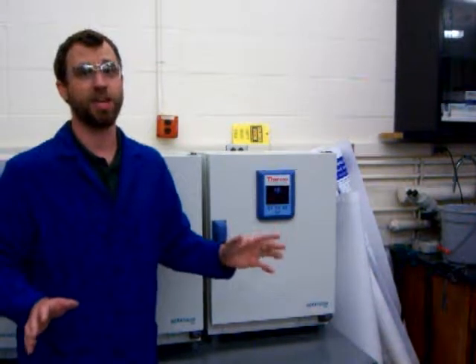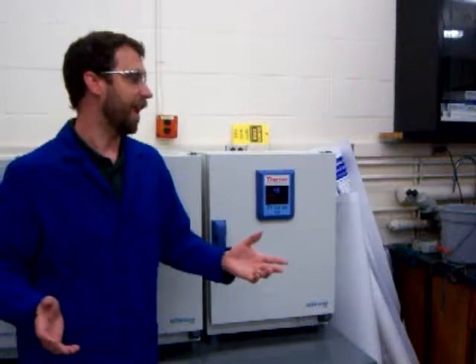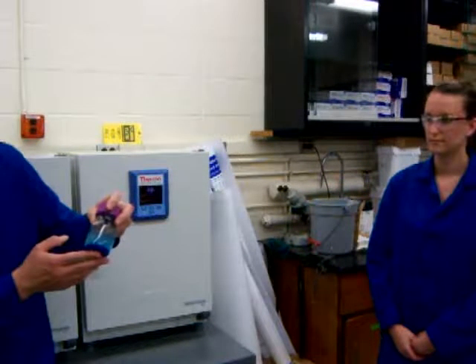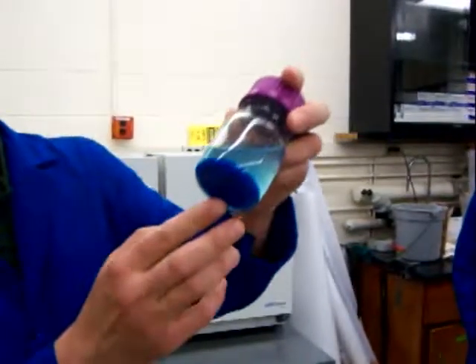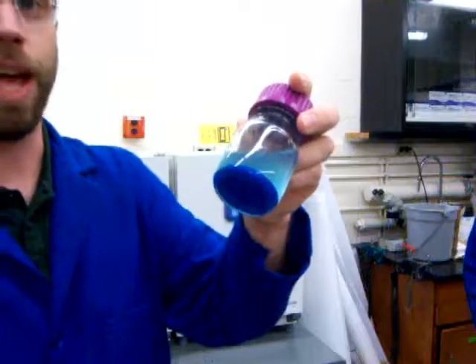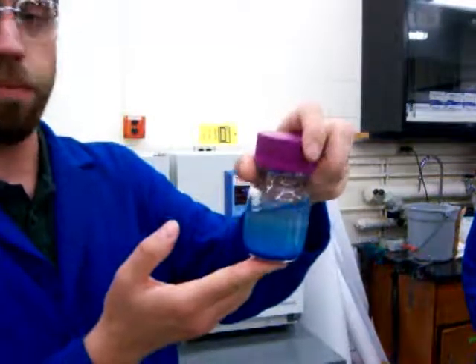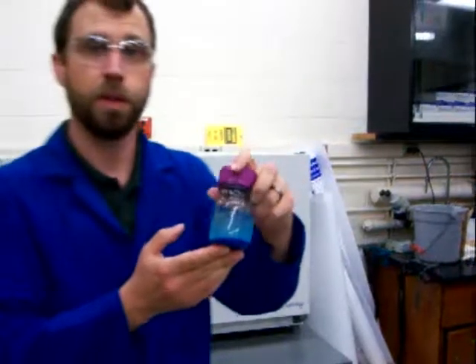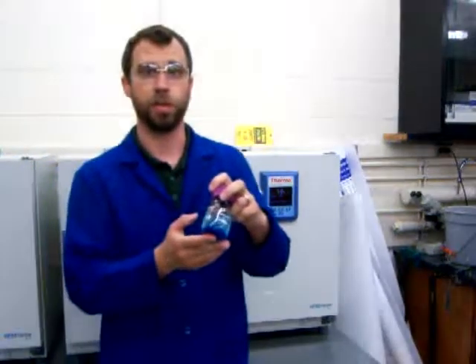But in the spirit of any good cooking show, we've already carried out the reaction, so we can actually show you what this will look like in the morning. So after cooling, you see that there's a dark blue precipitate in the bottom of the jar. That is our metal organic framework. So the next step would be to filter this, collect the solid and dry it, and then we have metal organic framework for future experiments.